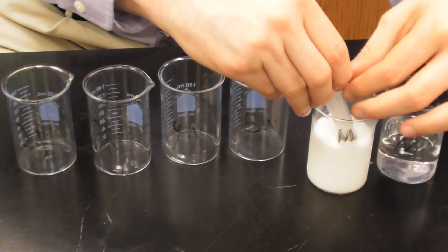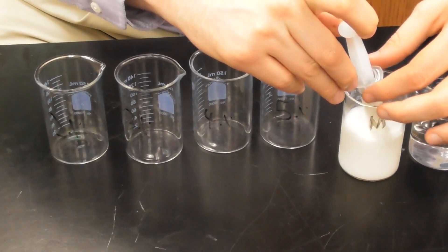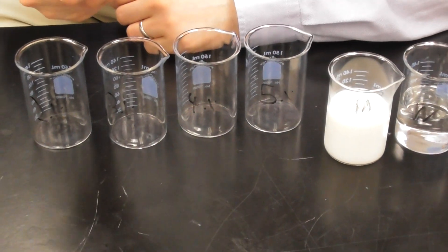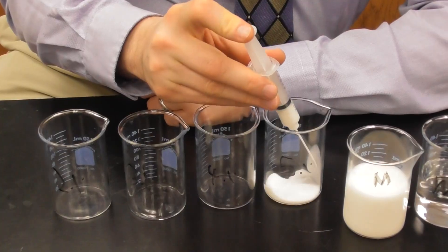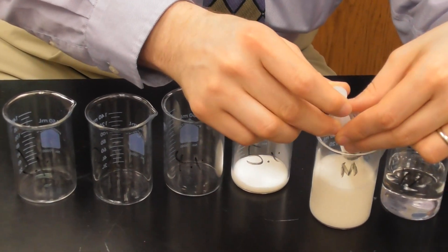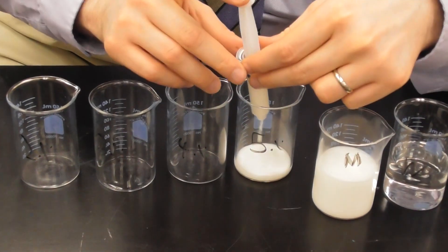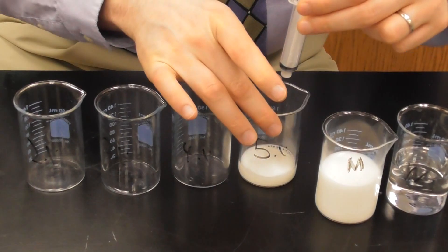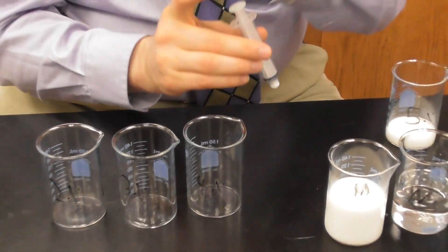I have pre-labeled all of these 5%, 4%, 3%, and 2%. M, this is my bench reagent container for M, this is already at 5%. I need 20 cubic centimeters in each of these. So what I'm going to do is I'm going to start by taking 10 because this 10 cubic centimeter syringe only measures up to 10.